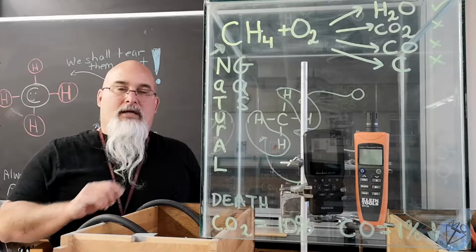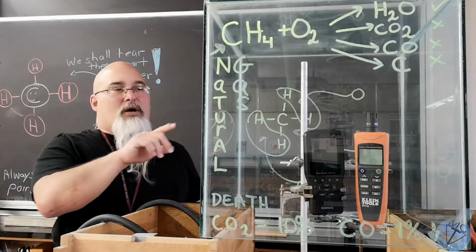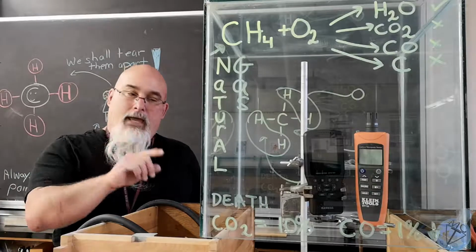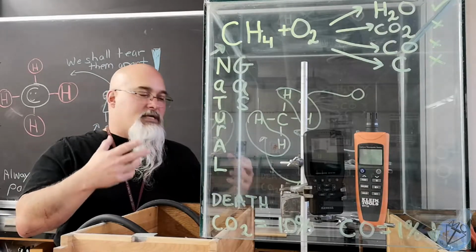The detector on the right, the red one, detects carbon monoxide. So we're going to observe these when the Bunsen burner is burning clean and when it's burning dirty, or what we call very rich, and we'll get a pronounced yellow flame.